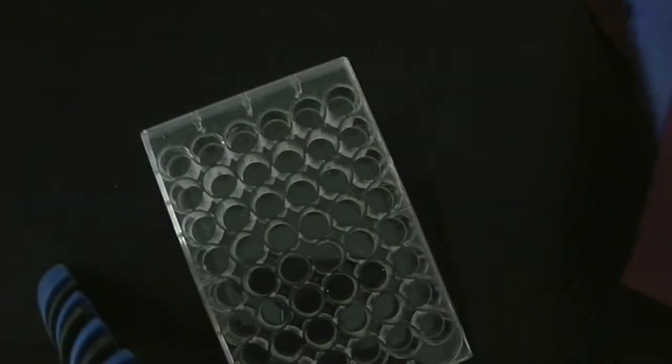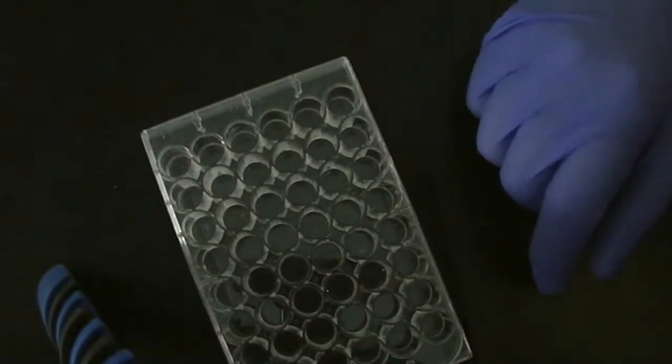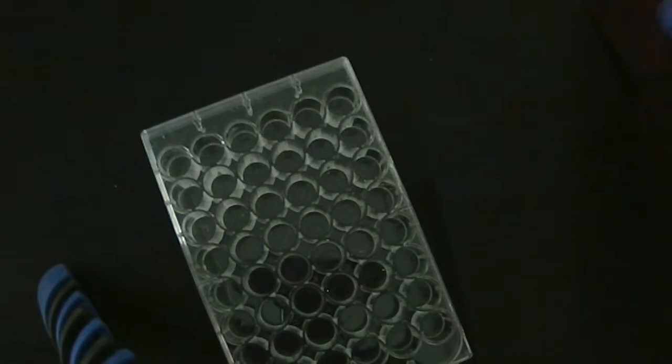We're going to be putting in 3 things. Do you think it matters what order I add those 3 things? Yeah, you can vote yes or no on Zoom. Do you know how to do that? Okay, I've got 7-2. Okay, so I think the overwhelming majority is that order matters, but overwhelming majorities are not always right. So let's do this a scientific way and test.